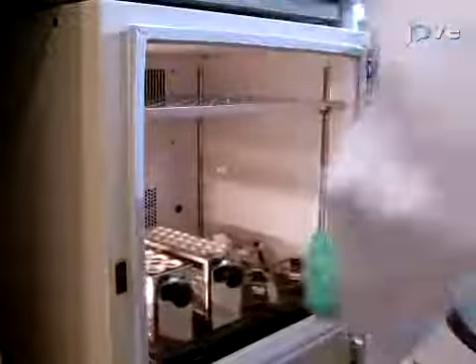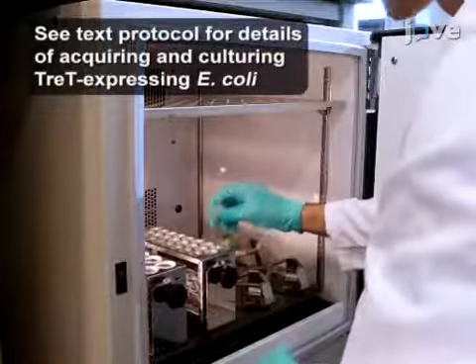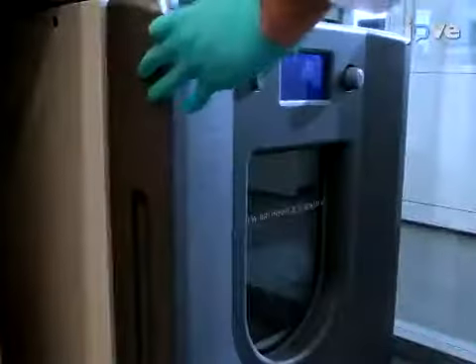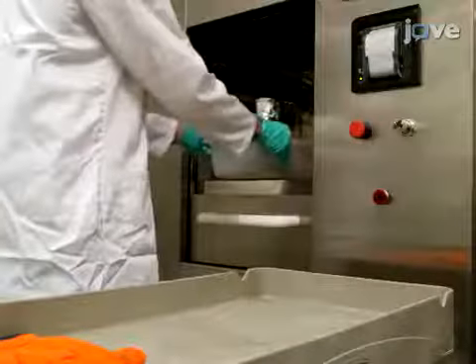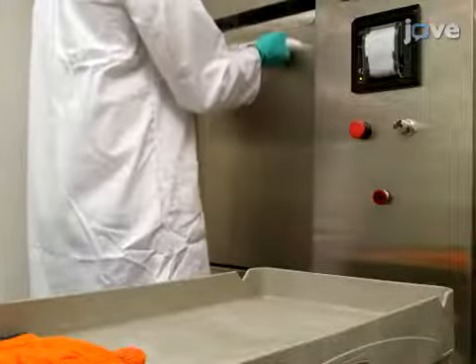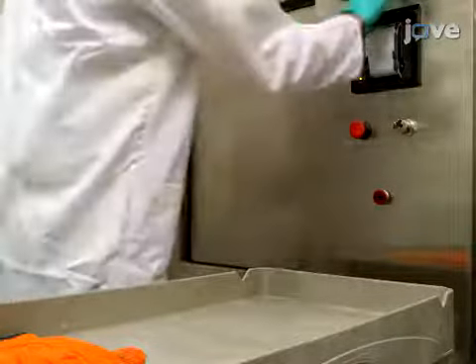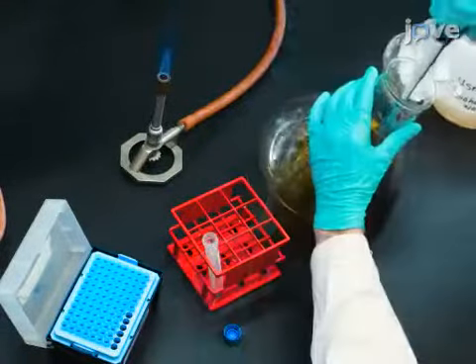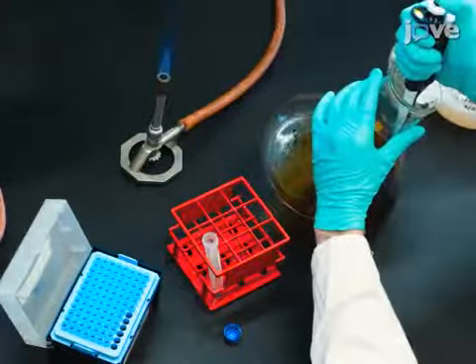Prior to beginning the procedure, prepare an overnight culture of Tre-T expressing E. coli. To begin the Tre-T expression procedure, place 750 milliliters of TB growth medium in a 2,800 milliliter Fernbach culture flask and autoclave it. Add ampicillin to the broth to achieve a final concentration of 100 micrograms per milliliter.